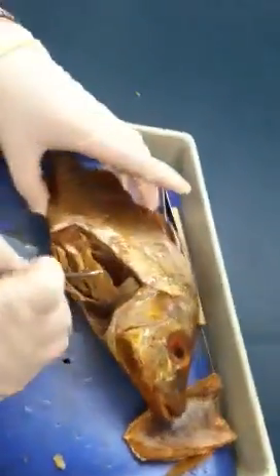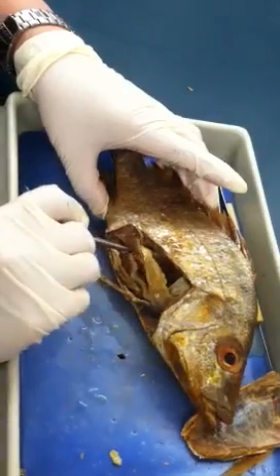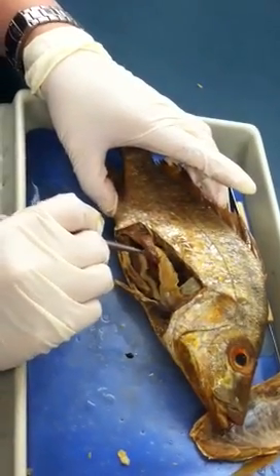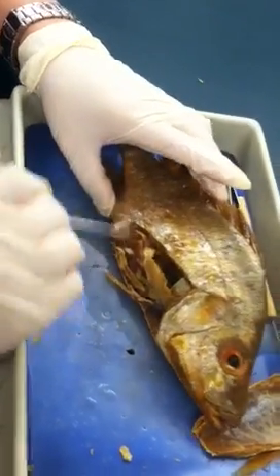So in ovary and testes, in general we just say that's gonad. It's the swim bladder. And that's all.